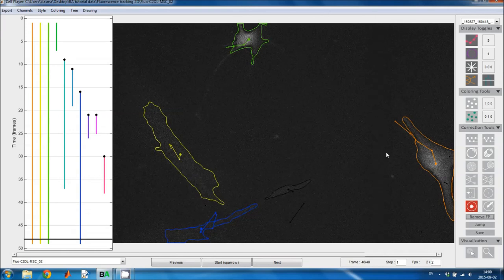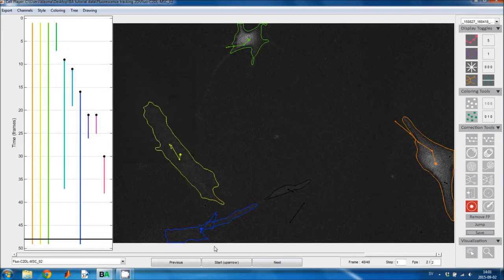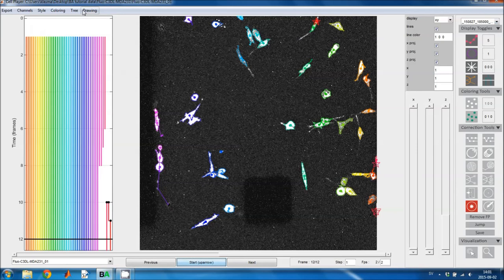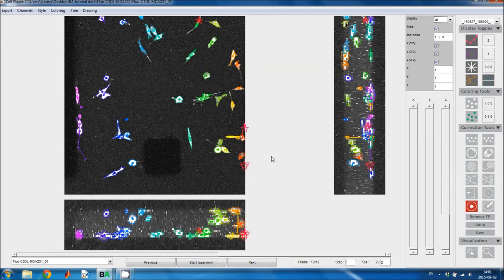And I'll remove the false positives just to clean up a little bit. I'm sure there were more mistakes, but I'll just save these for now. And then we'll go to the 3D data set. And the lineage tree is less useful here, so I'll hide it for now, and I'll show all 3D views, because there you can catch more of the track linking mistakes. Also go back to the first image.